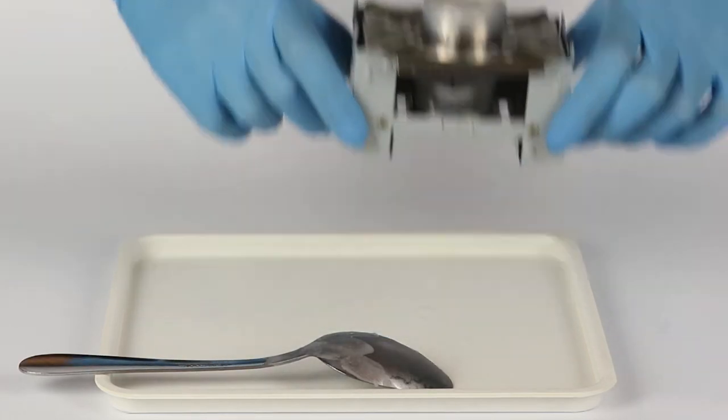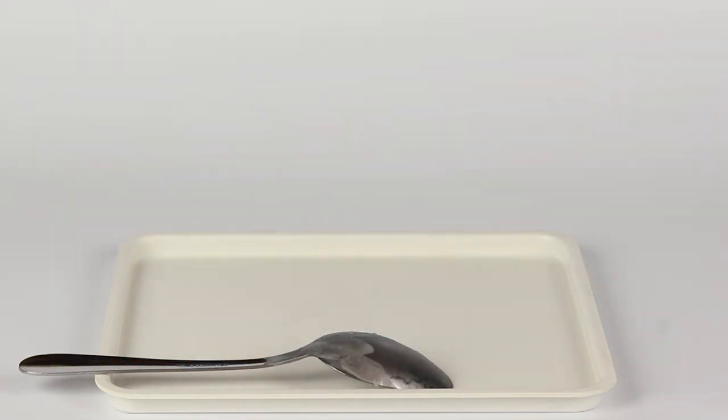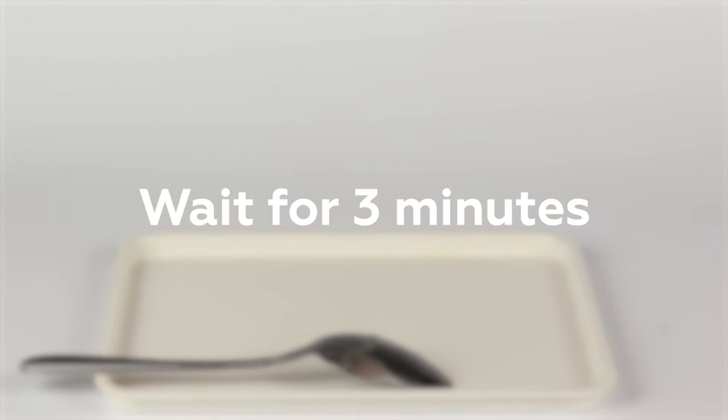The paraffin will act as a protective layer, preventing the surface of the spoon from touching the solution. Wait for three minutes.